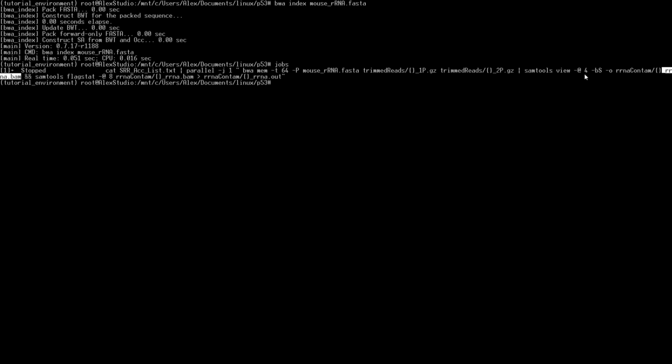-b is going to tell SAMtools that the output we want is in BAM. So here we have BAM. And then -S, just to be safe. They say that it doesn't have to be in there for the new SAMtools view, but in the older versions, if you specified -S, that told SAMtools view that what's being fed in is going to be a SAM file. So since the output here is .sam, if we didn't do the rest of this line, we could just run BWA mem, and the output would be our SAM file. We're going to feed that in, tell SAMtools view that we want the output to become BAM from a SAM file, and then -o, we're specifying that output name.